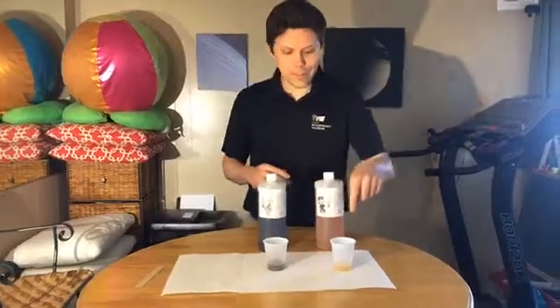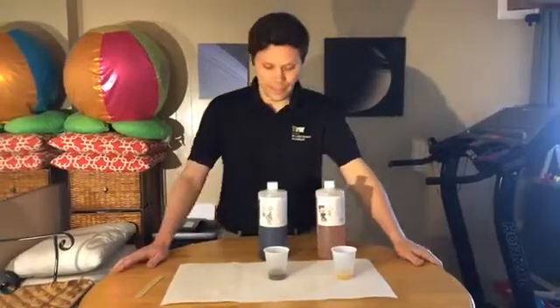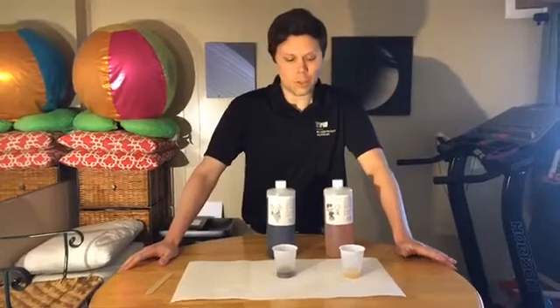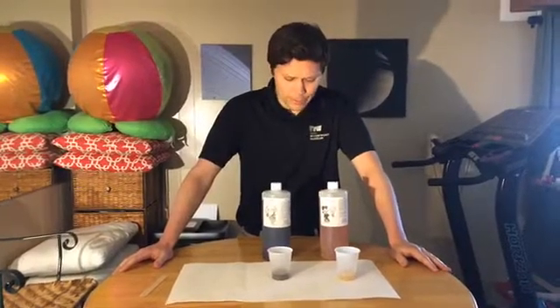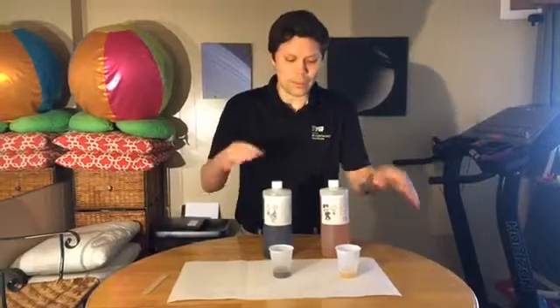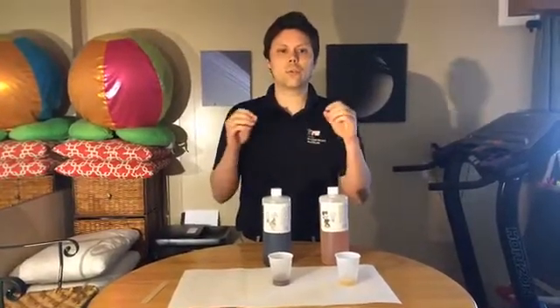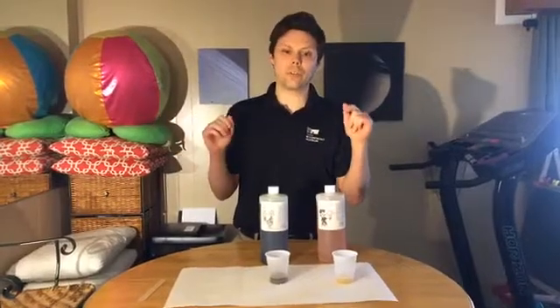We're going to mix the amine with the isocyanate, two different chemicals, and get them to react. And in a chemical reaction, we're going to have atoms from one chemical changing places with atoms from another chemical, and we'll get two new different chemicals as a result.